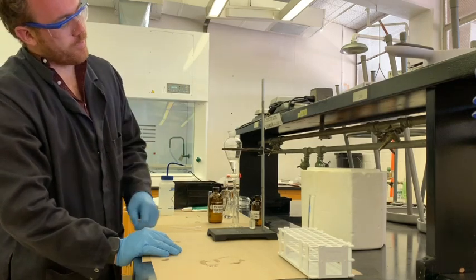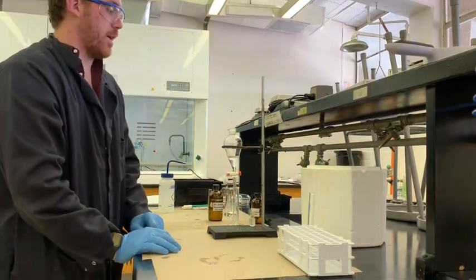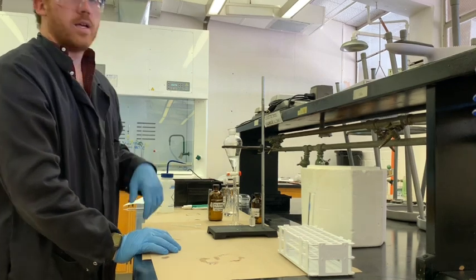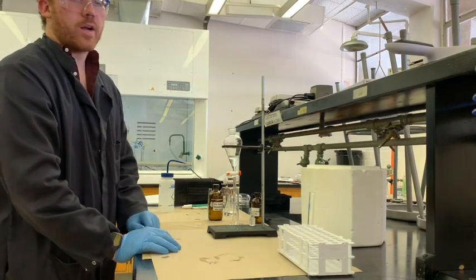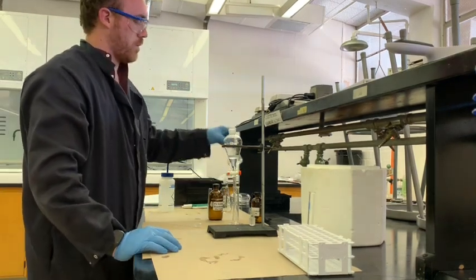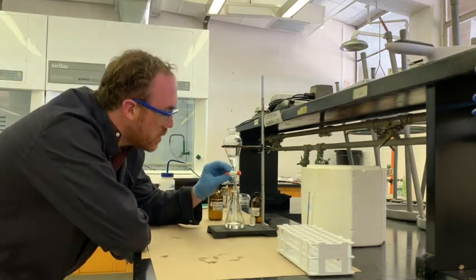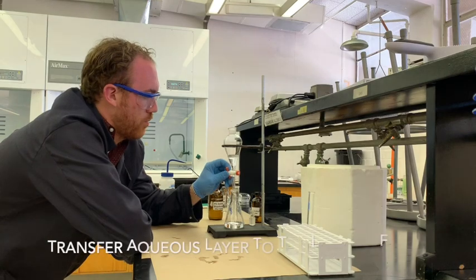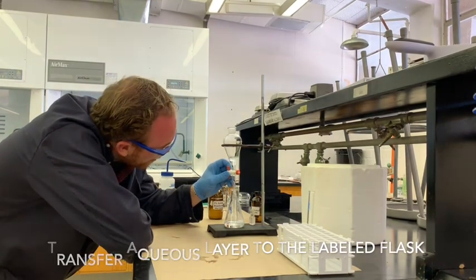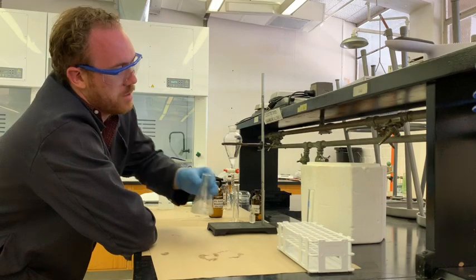So now we have two layers again, and the top layer as before is going to be our organic layer. So the bottom layer we can get rid of because it is of no use to us.